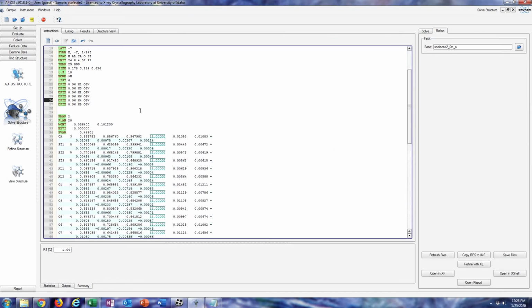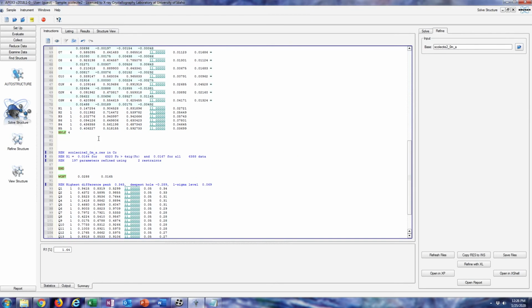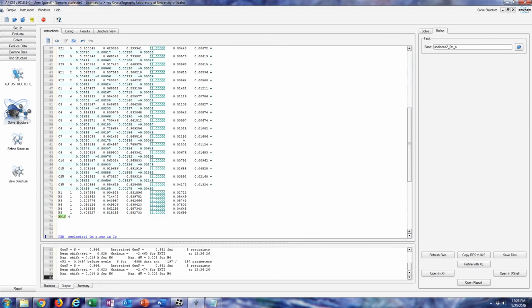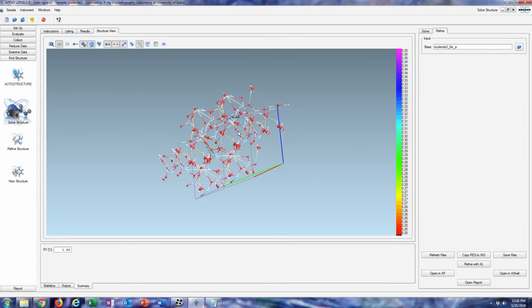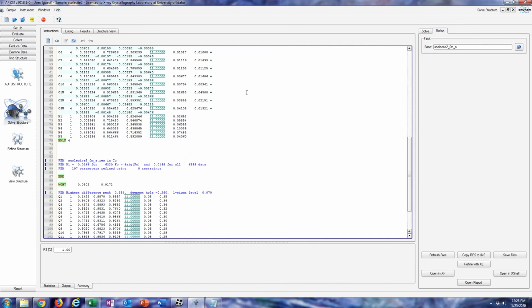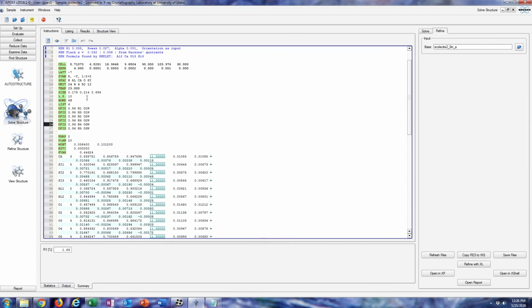And there are other things that you can do with ShellX. I don't really know how to do these, but I just know how to fix the angle or fix the distance. There are other ways of trying to fix angles and so forth. So the R value went a little bit up, but that's fine. I'm perfectly okay with it because we know that our model is correct anyway.